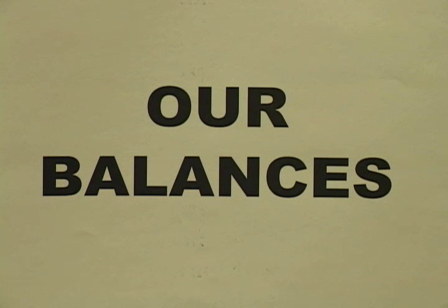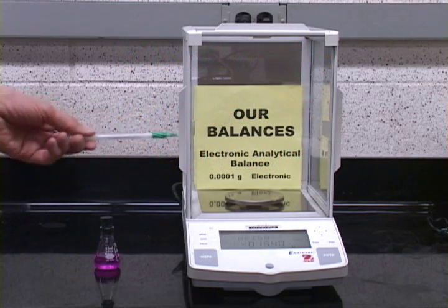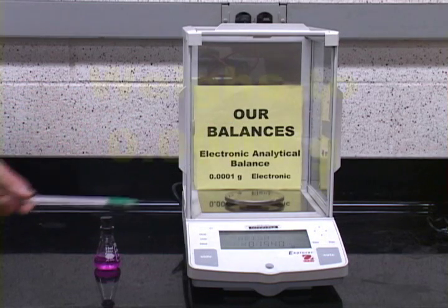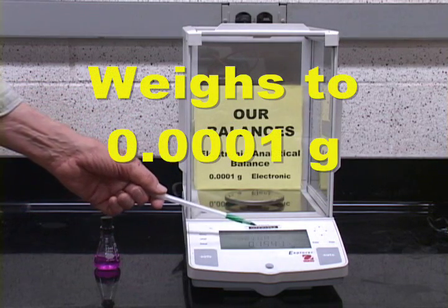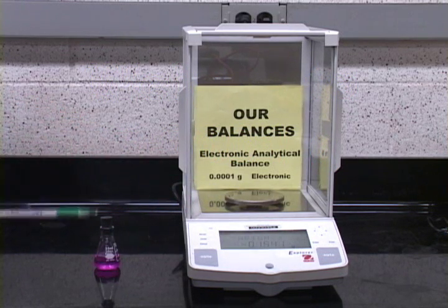With that introduction, it's on to our feature presentation, the balances which we will actually use in our laboratory. Probably the most important balance you'll be using this semester is the electronic analytical balance. Now remember, this is an analytical balance and it weighs to 4 decimal places in grams.